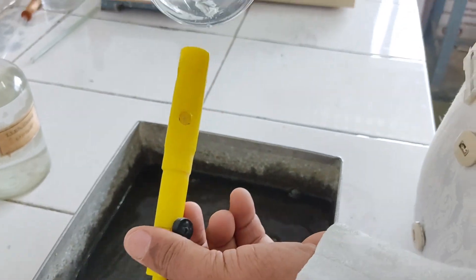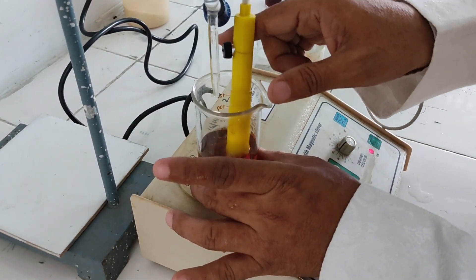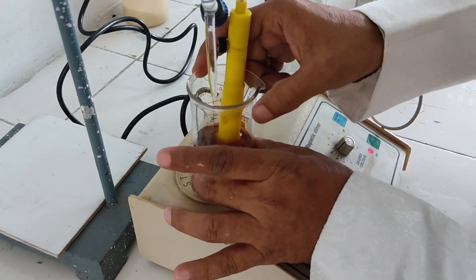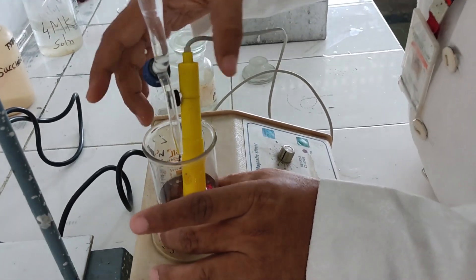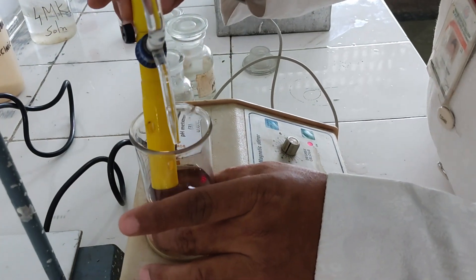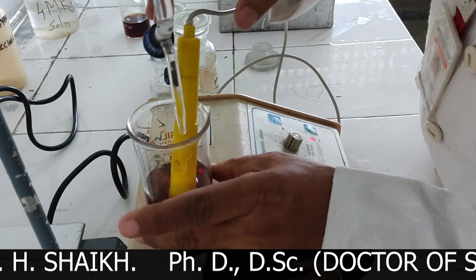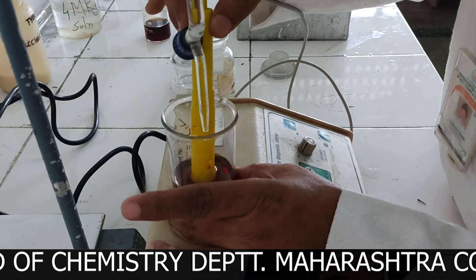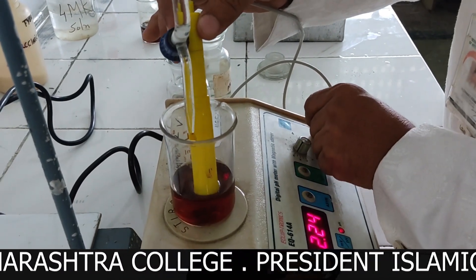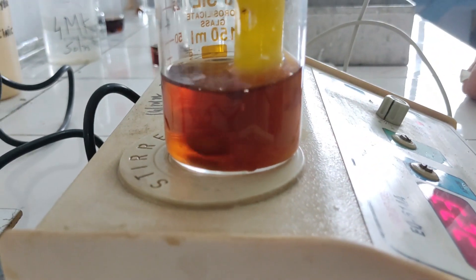It has to be cleaned like this — you can see the glass bulb has to be cleaned thoroughly. Now I will be putting it into my solution carefully from the side. You can see the magnetic stirrer is getting disturbed; I will put it off, reposition the stirrer, and then put it on. Yes, you can see I am putting it on — the stirrer is moving now. I will place my electrode here.